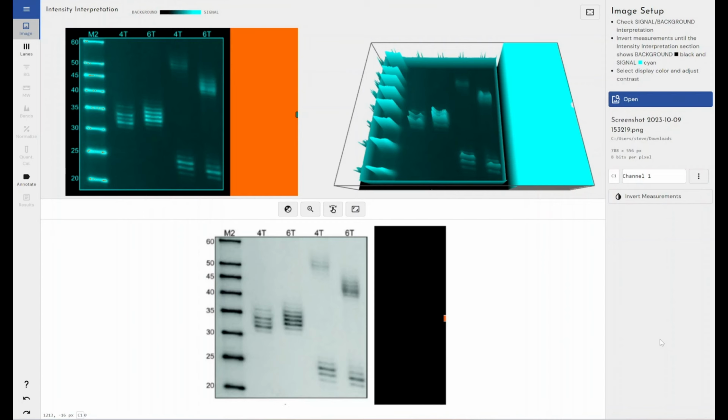Now, Phoretix 1D is compatible with phosphor imaged RNA. So if you're using film or a high-end scanner that is compatible with phosphor imaging, you can use images from that, or chemiluminescent based techniques of RNA visualization on a membrane. It all depends on what reagents and scanners you've got available to you. If you're using a standard gel doc with chemiluminescent techniques, that'll work fine as well.